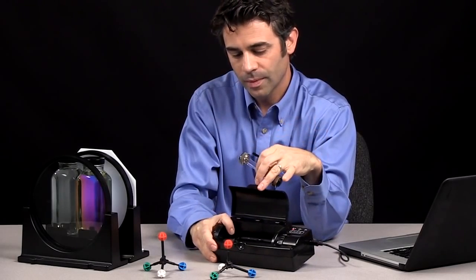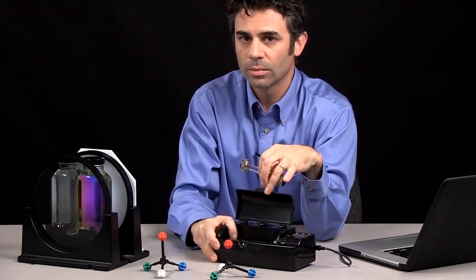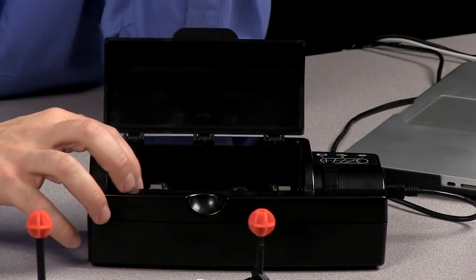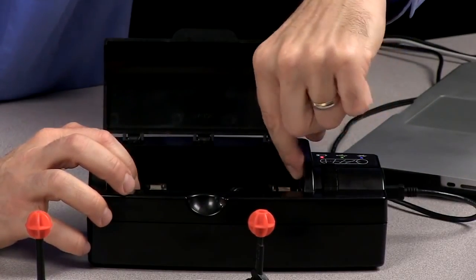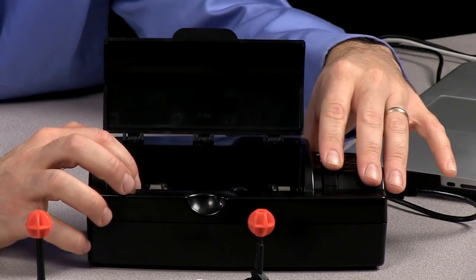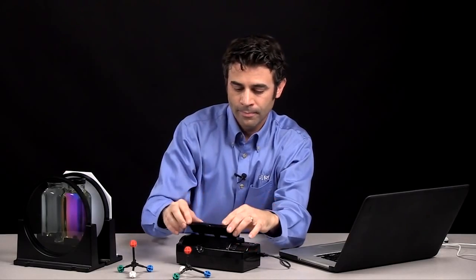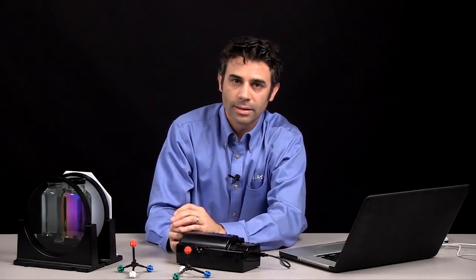In the polarimeter, there is a 589 nanometer monochromatic light going through a polarizing film on this end and a polarizing film on this end in front of a detector that I can rotate around just like I could rotate this around. So I have monochromatic light that's getting plane polarized, going through my sample, and hitting a detector.